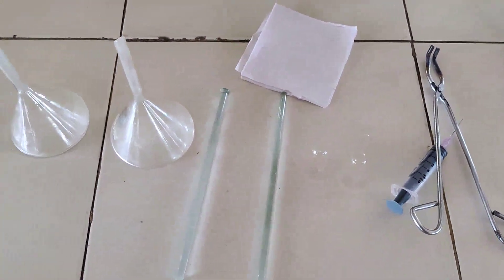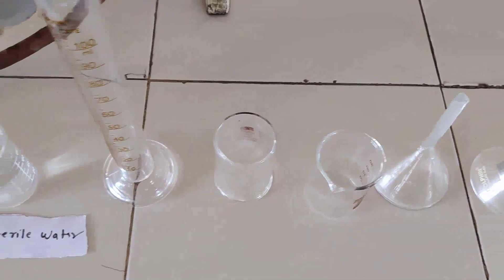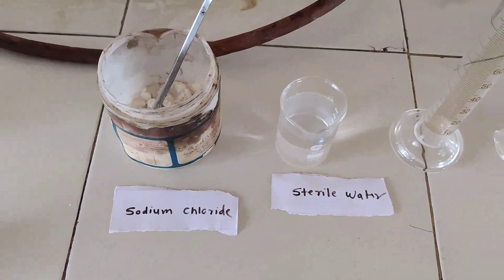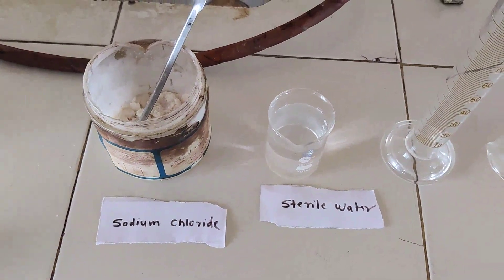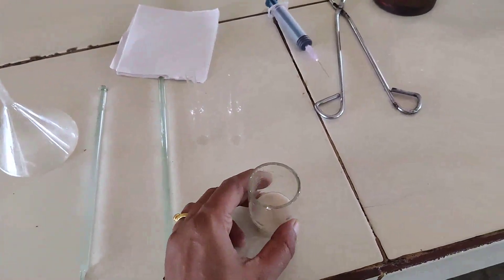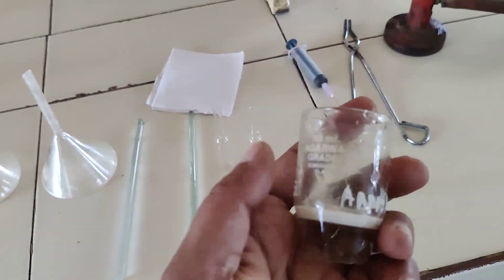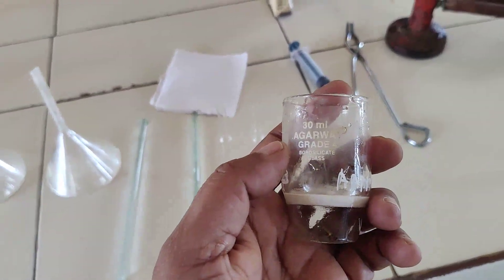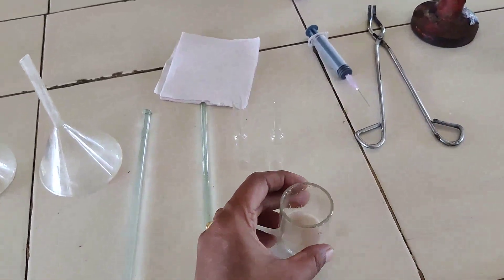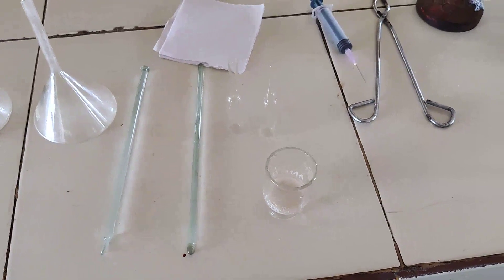This much glassware is required for this practical, along with only one chemical — sodium chloride — and sterile water for injection IP. One additional filter is also required: a sintered glass filter, which is made up of borosilicate glass. This special type of filter is required for filtration purposes.